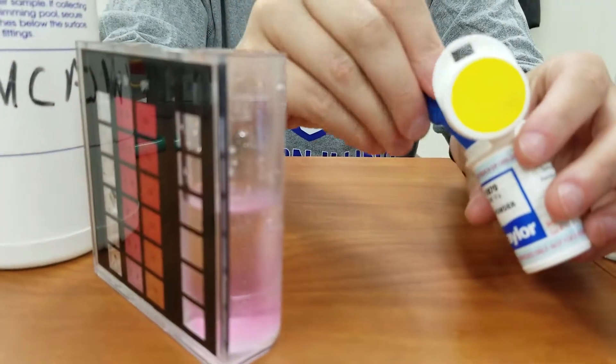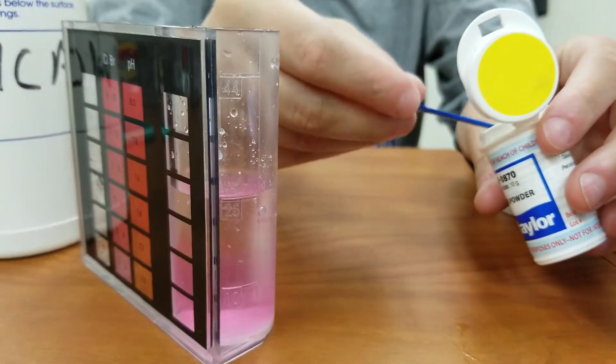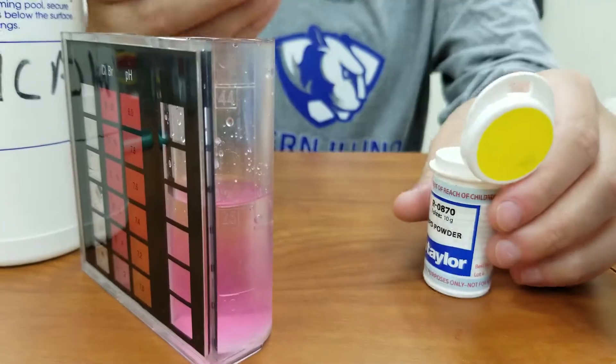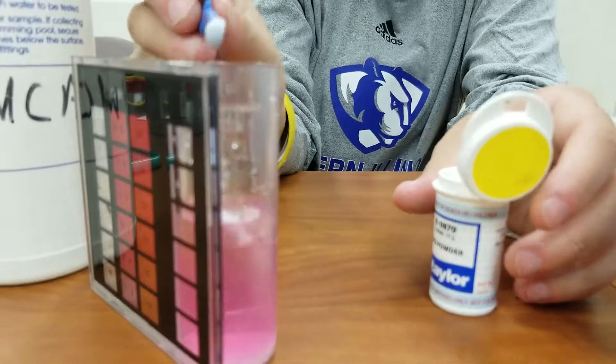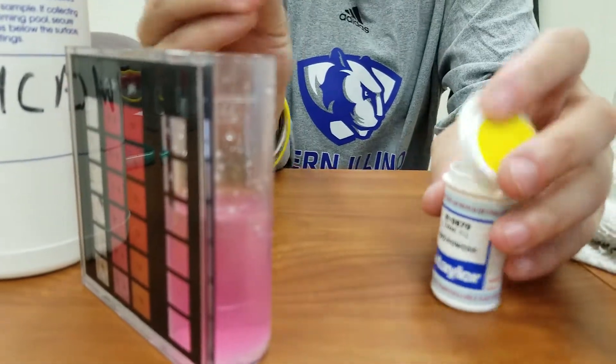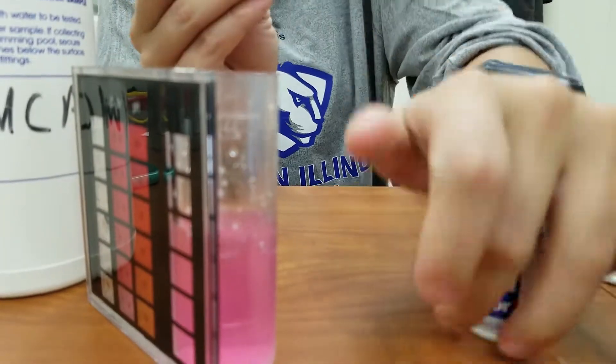You can go over on the scoops, but you have to get at least two scoops. So that's not an exact science. Try not to waste this because these are kind of expensive. Absolutely. So don't overdo the two scoops by a whole lot.